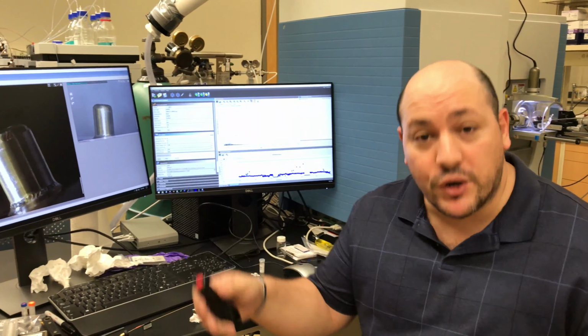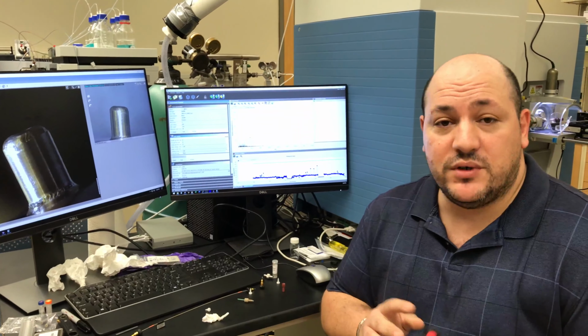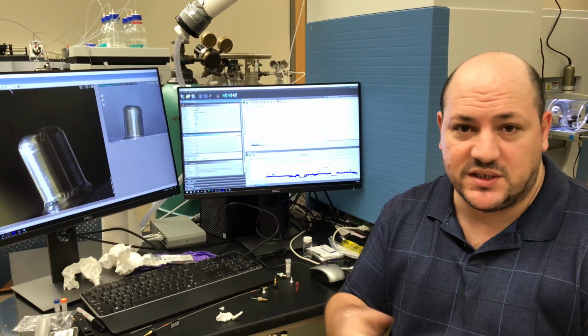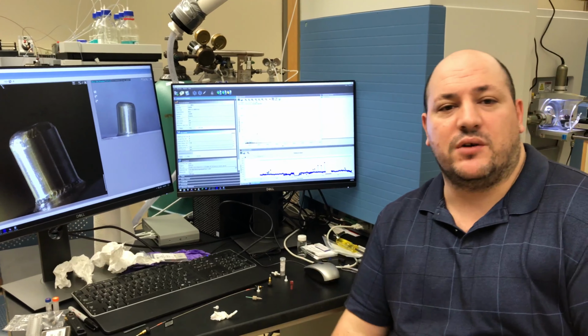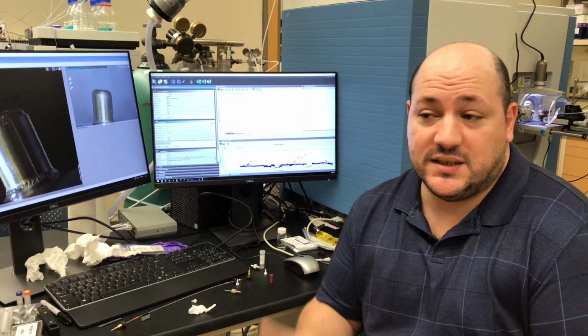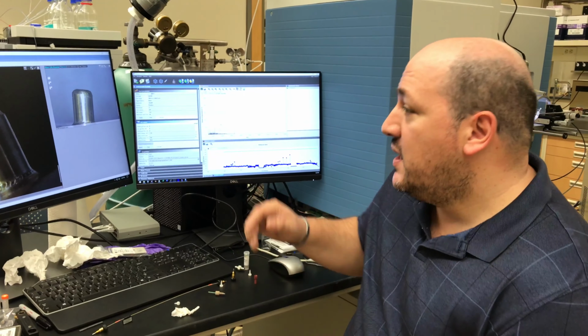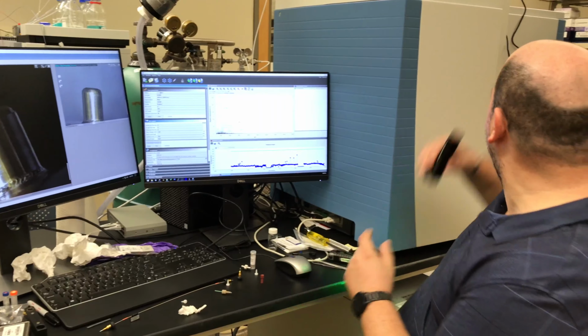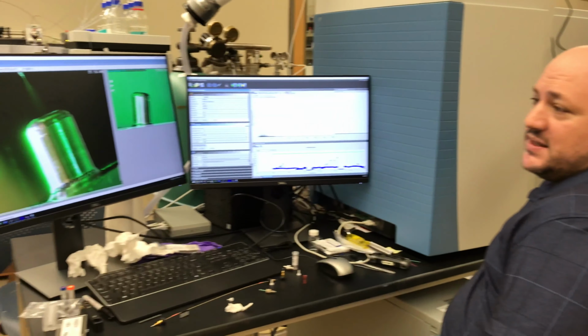Hello everyone. Now this is our Orbitrap instrument. It is the new addition to our portfolio of instruments. It's an instrument that we use most of the time for proteomics, bottom-up proteomics. If you want to know the composition of a sample from the point of view of proteins, this is the instrument you want to look at. It works with nanospray, and I will show you very quickly what a nanospray is. It's that spray there.